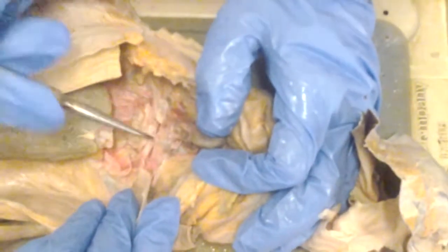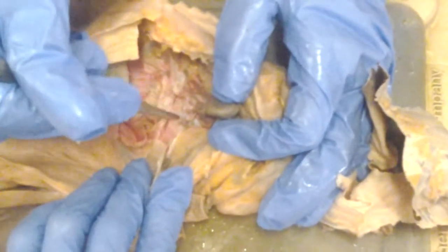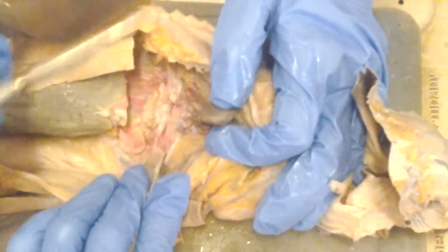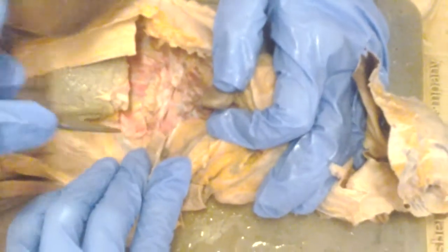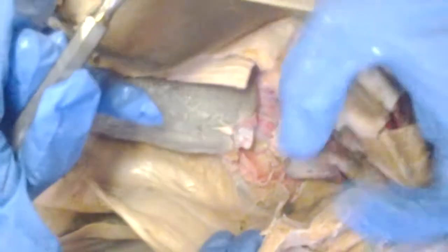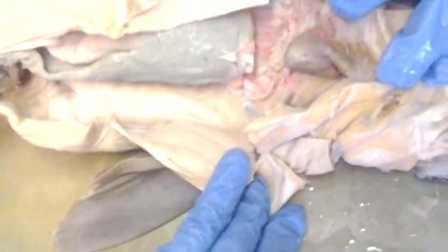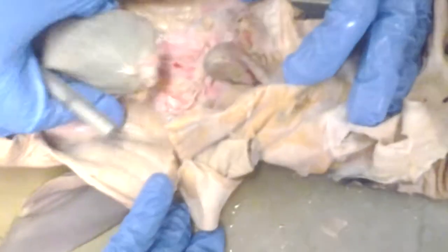Can you lift it? Yeah, it's a little bit ripped on this specimen, so it's right under here. It's supposed to be a sac, right? Yeah, it's a sac. It's usually blue. Yeah, back here would be the posterior cardinal sinuses inside here. Are those the sperm sacs, right? No, these are not the sperm sac. The sperm sac is way back here. Okay.